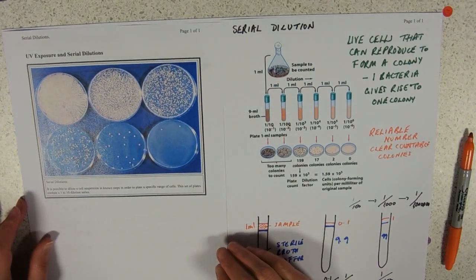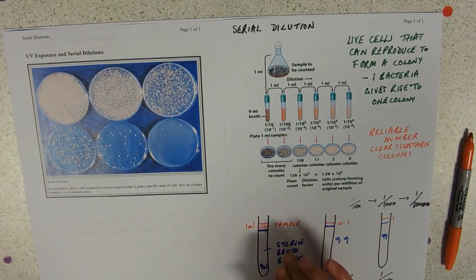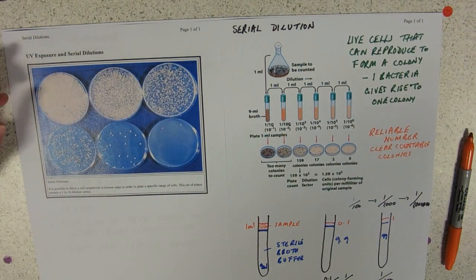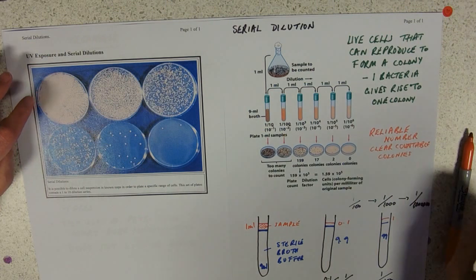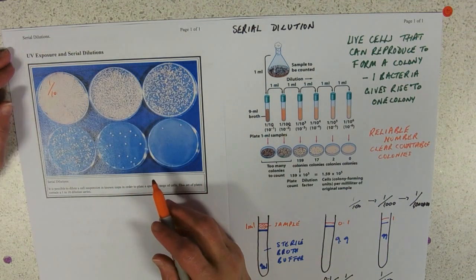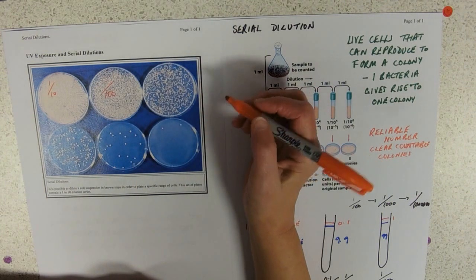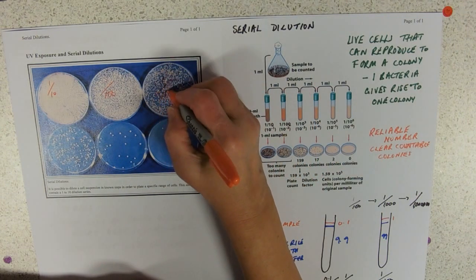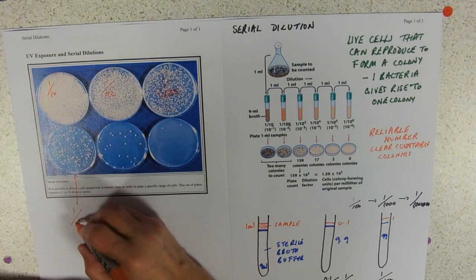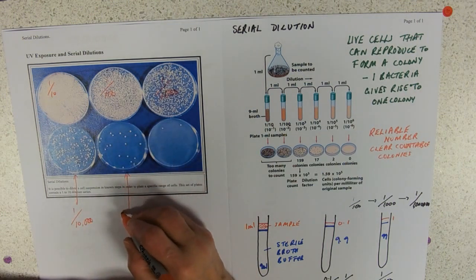So this is a really lovely picture from the internet. I love the internet. This is the results of a count. This is a 1 in 10 dilution series. So this one here is a 10th diluted, and you can see that the bacteria pretty much cover the plate. We've got a few gaps appearing in the 1 in 100. We've got some more gaps appearing in the 1 in 1000. This one would be 1 in 10,000 then. Another 0 on.